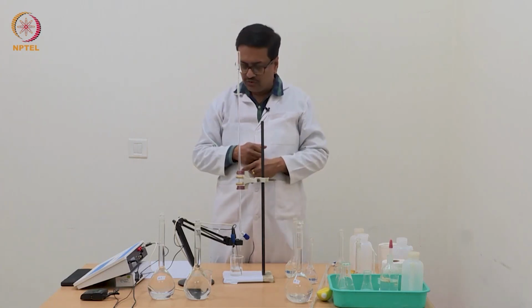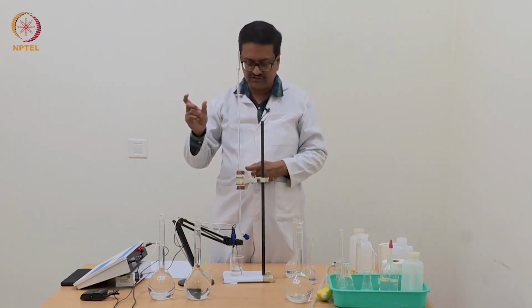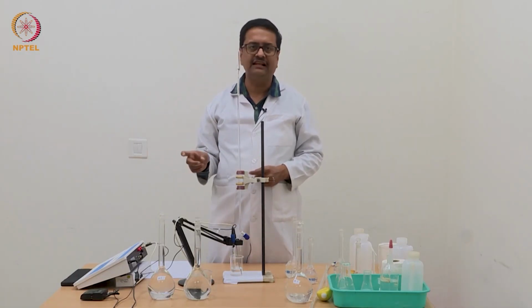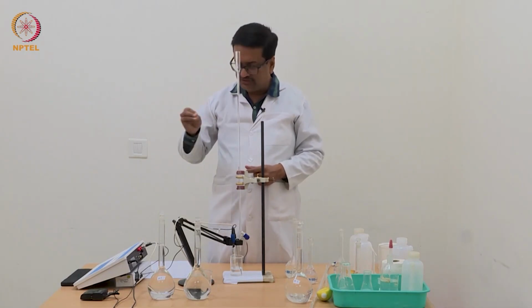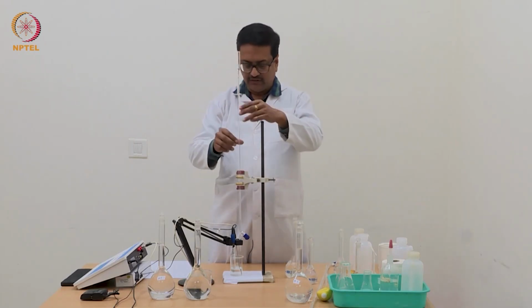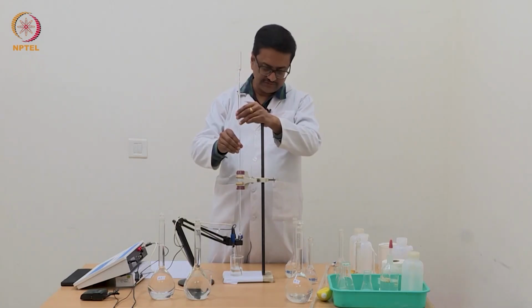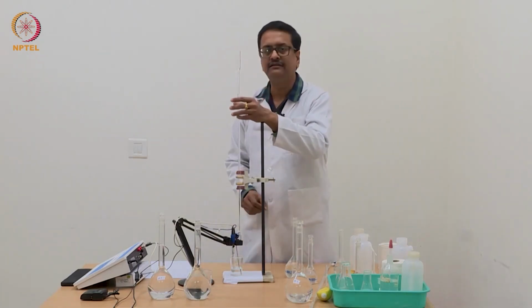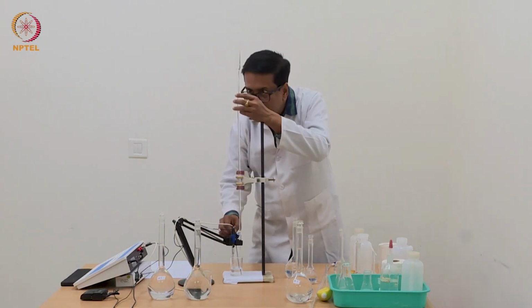You have two carboxylic acid groups, and one carboxylic acid is completely deprotonated to monooxalate. So at that point the pH will increase more than the previous readings. So we need to note down that reading very carefully.